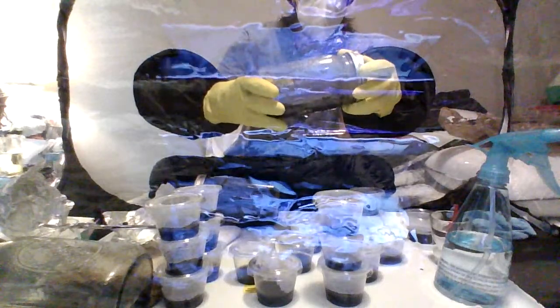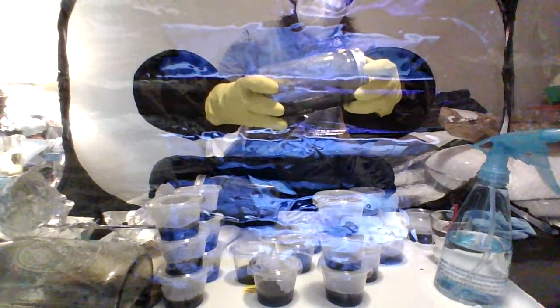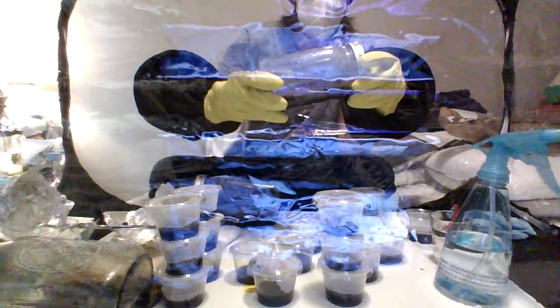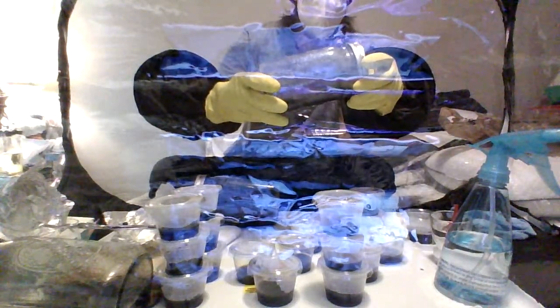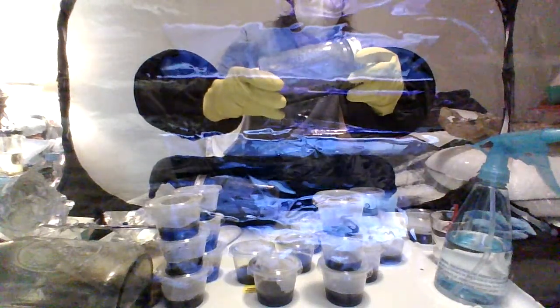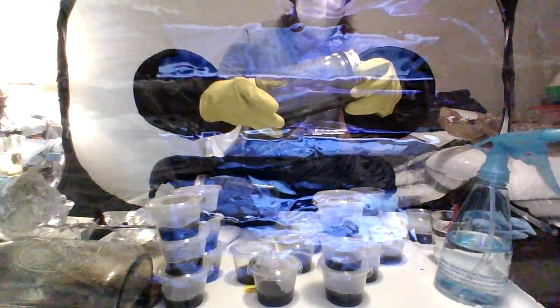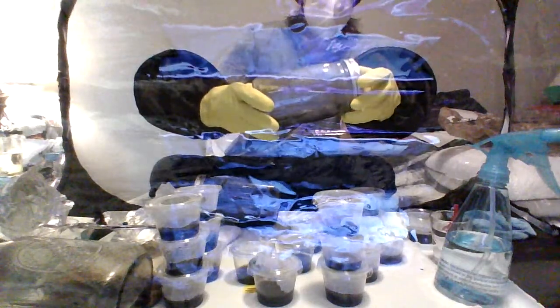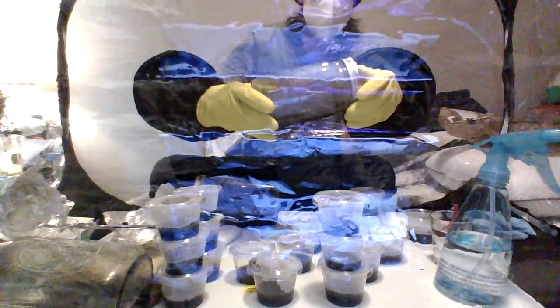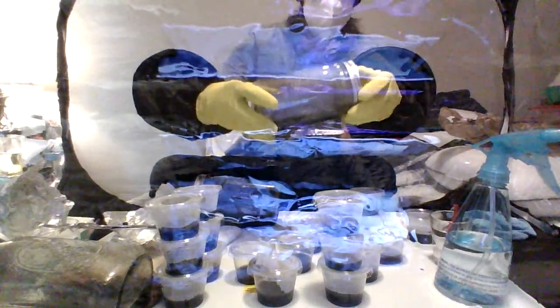The reason being is that bacteria can only move through water, right? If there's no water for it to move through, it can't. There's no medium. Whereas the mycelium doesn't have those restrictions, those limitations. It can make that gap and thereby leave the bacteria behind. This is called trenching or sequestering, I think. This is just one method to do a cleanup.